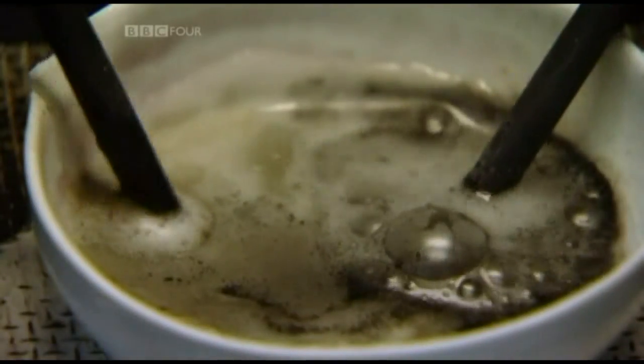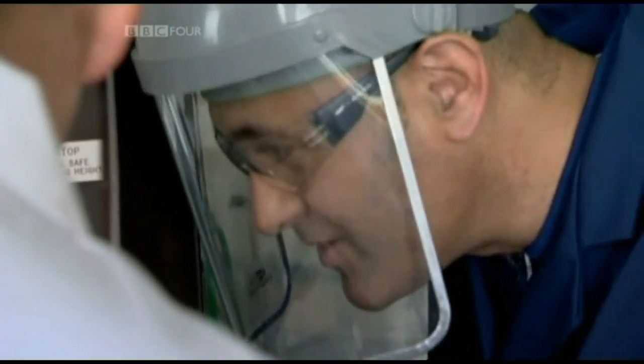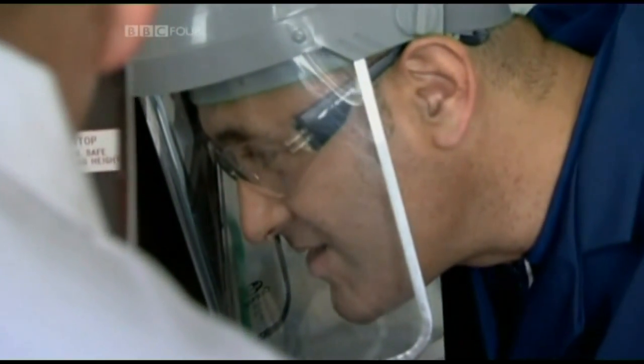And that's the potassium on the surface and it's just burning quickly in oxygen. There's another one, look. Yes, it's reacting away. Just like a tiny pink matchstick popping on the surface. Yeah, exactly.